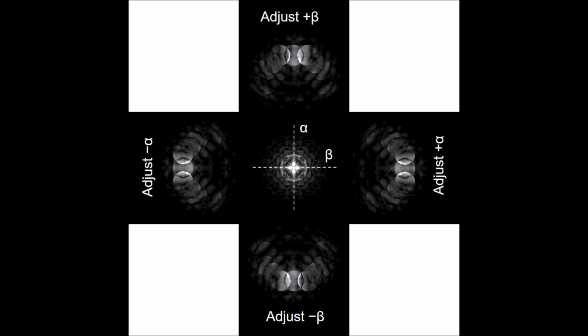But the only caveat, of course, is I'm operating in that same indicated camera length regime. This is 98 millimeters indicated or higher. Again, unique to this specific microscope. And that, in a nutshell, is how you generate a tilt map or tilt cheat sheet.